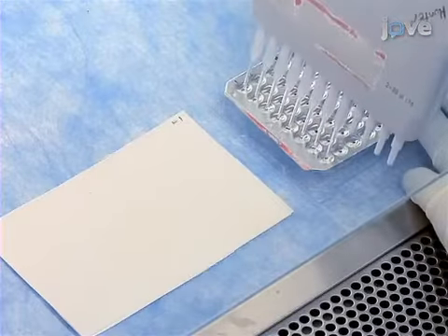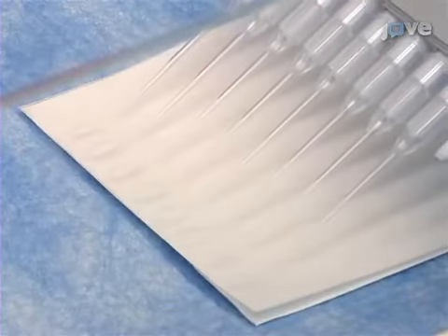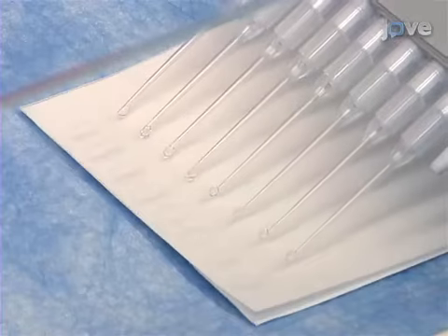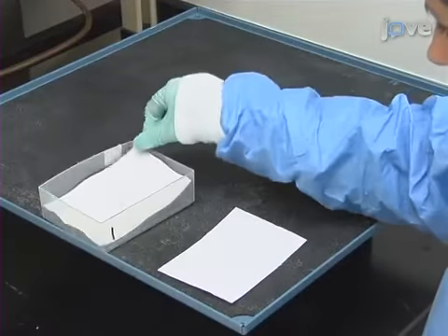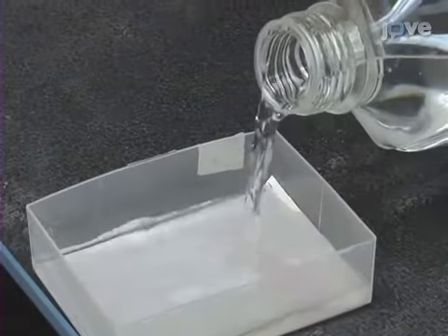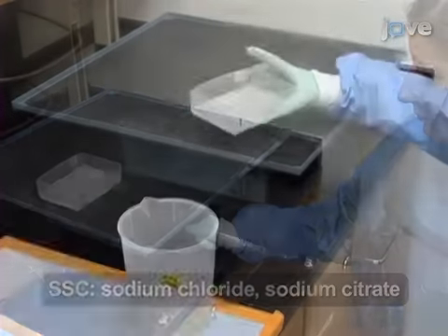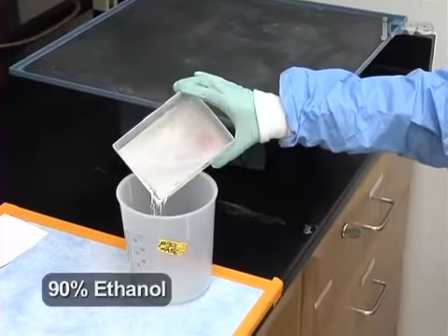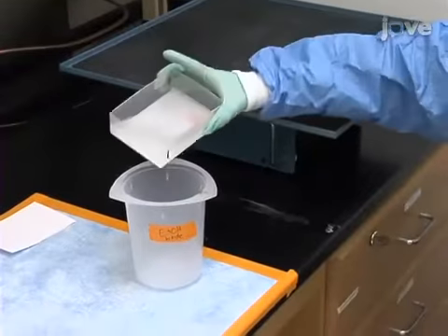Transfer 5 microliters of each sample to DE81 paper and allow all the samples to air dry for 10 minutes. Place the blots in separate washing containers. Subsequently, wash the blots 5 times with 1x SSC. Then 2 times with 90% ethanol for 5 minutes per wash, before letting them air dry.